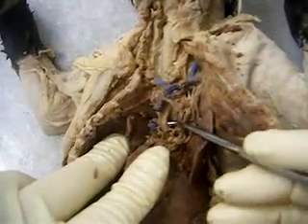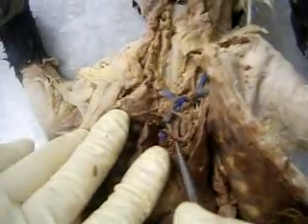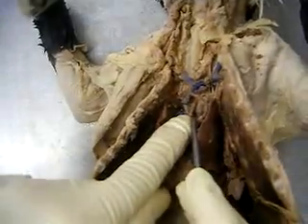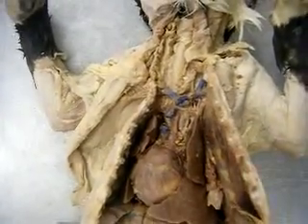And now, what I was saying earlier, this is the brachiocephalic. That's the first branch. So you can think of them as coming in alphabetical order. The blood comes out, hits the brachiocephalic first, B, and then goes to the subclavian, S. So they're in alphabetical order, in the order of the blood, if that helps.